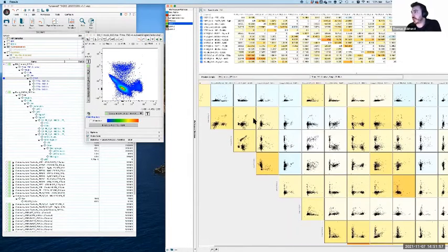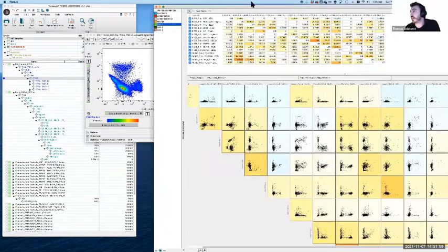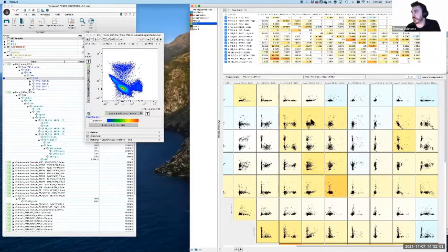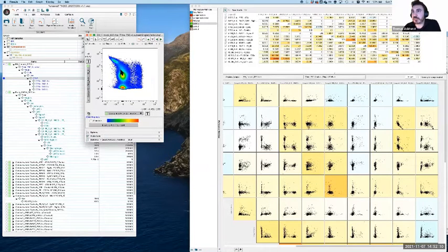So I can use this n-by-n to help me figure out where the issues are. And I'm just going to jump to it a little bit because I know where I'm looking. If I go to PE-Cy5, PE-Cy7 in this case, then I think I've found it. As this is getting brighter, it's leaning over to the left. This is my big clue. That looks like a mathematical correction that I need to apply. So good, that's a good start.